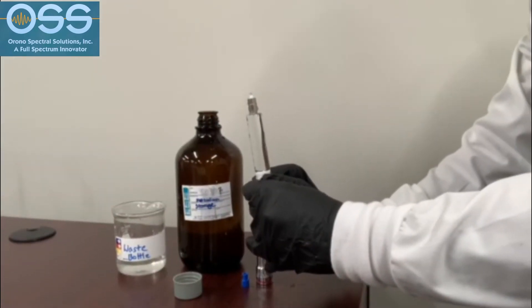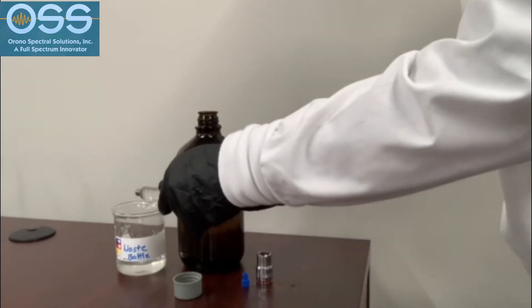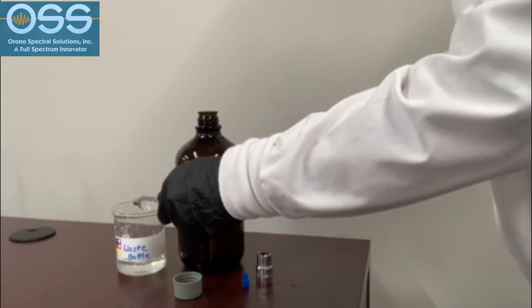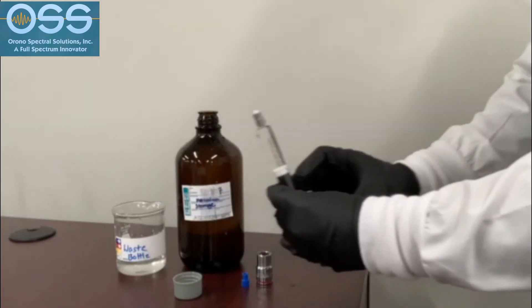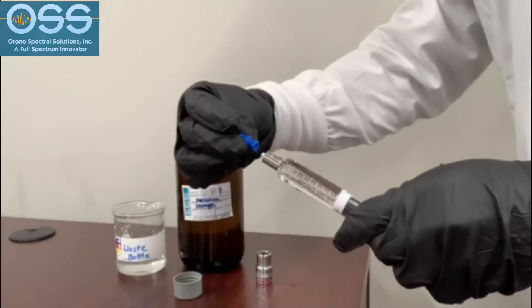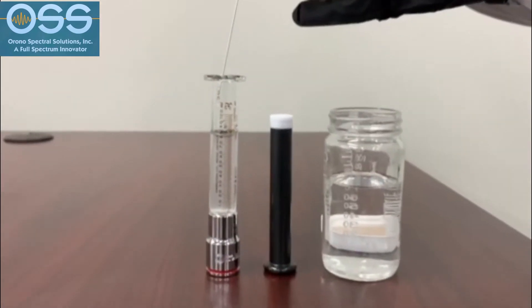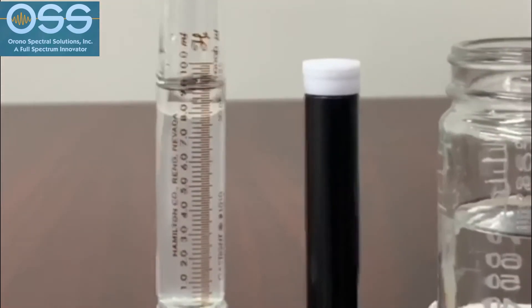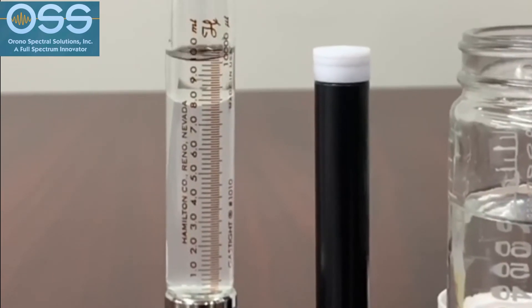8 mL of the homogenized sample is taken and 2 mL of solvent is added into a glass syringe. The sample is shaken to enable the solvent to extract all of the oil components, and then the water phase is separated out of the sample, leaving only solvent and oil components in the syringe.